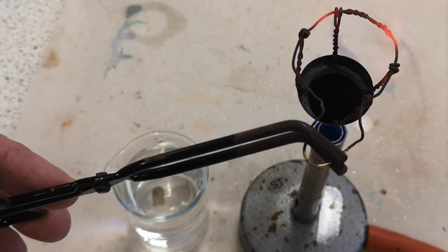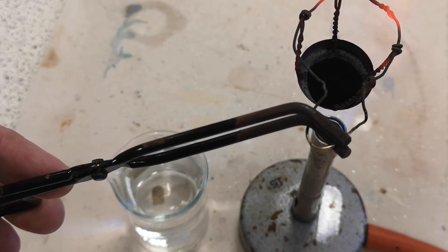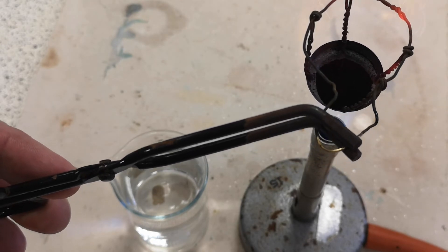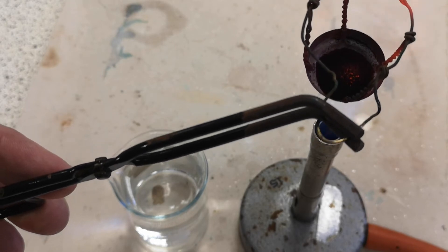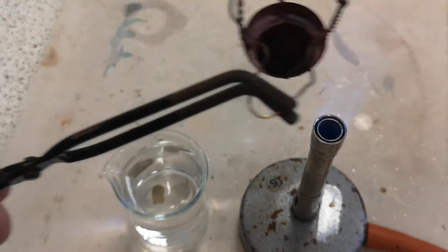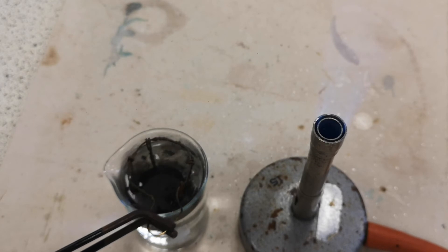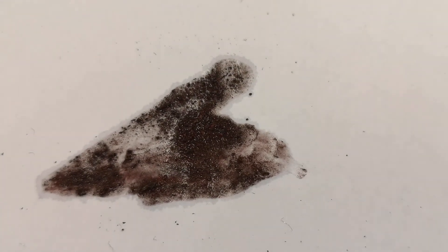This particular reaction requires too high a temperature to carry out in the laboratory with any degree of success, but you can show a similar reaction with copper oxide. Copper oxide and carbon are mixed and heated. You can see a glow as the reaction begins to take place, and if you then cool the mixture rapidly — by plunging it into water in this case — you can see brown copper left behind. It does need to be cooled rapidly though, otherwise it will simply re-oxidise back to the black copper oxide.